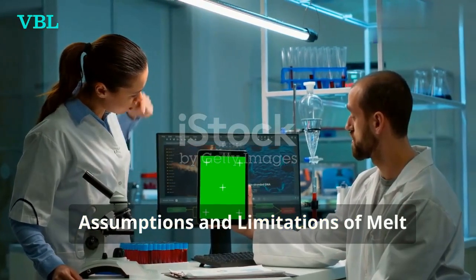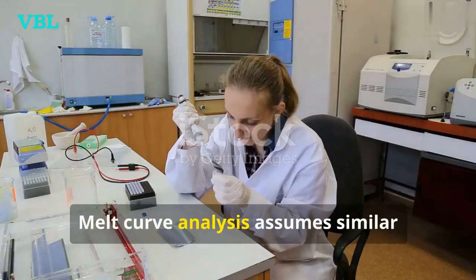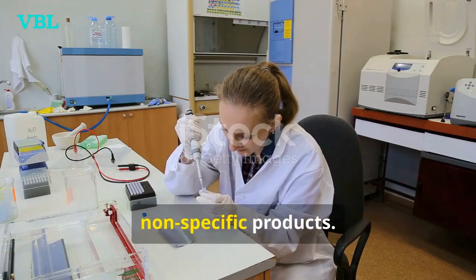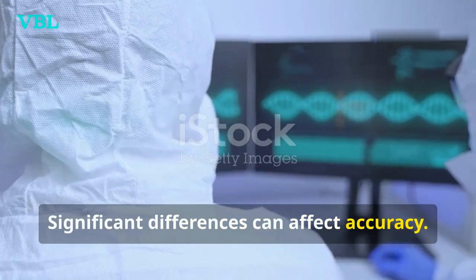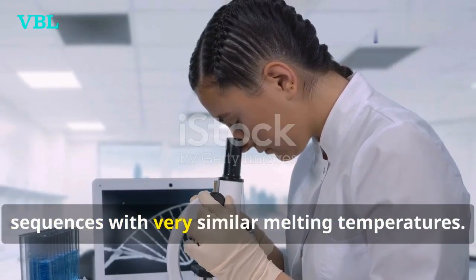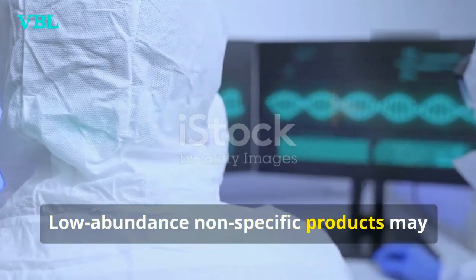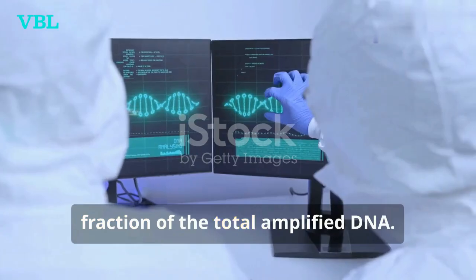Assumptions and limitations of melt curve analysis. Melt curve analysis assumes similar lengths and GC content for target and non-specific products. Significant differences can affect accuracy. It cannot differentiate between DNA sequences with very similar melting temperatures. Low abundance non-specific products may not be detected if they constitute a small fraction of the total amplified DNA.